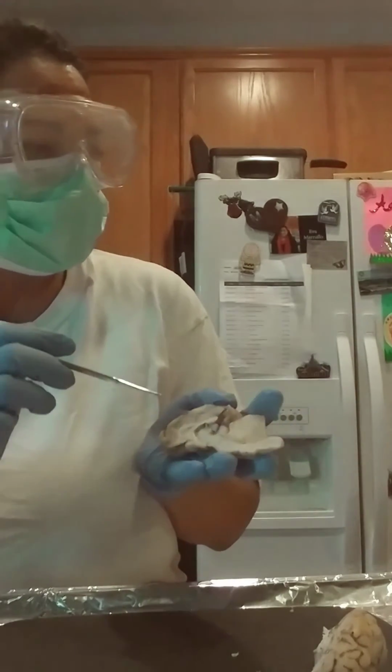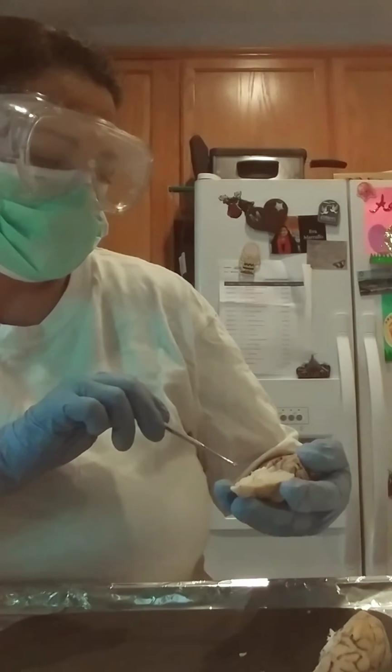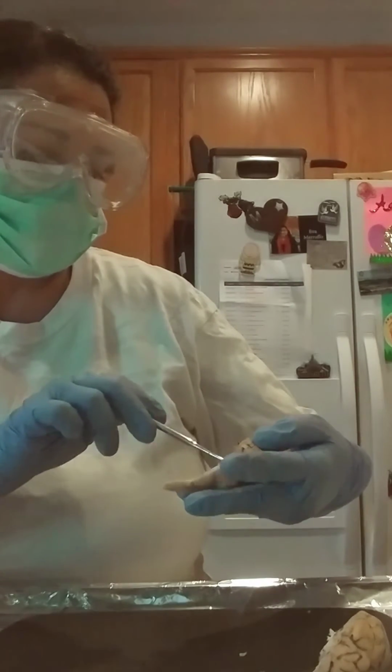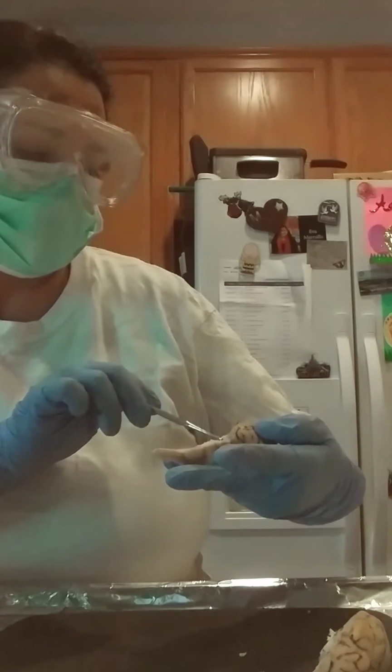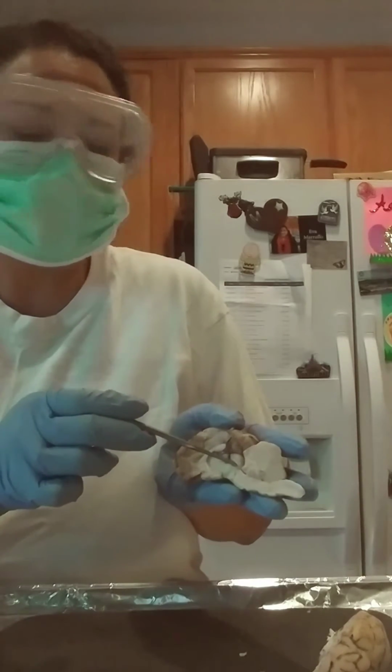And then the pineal gland is, let me see, the pineal gland was right back here. So I believe the pineal gland is right here in that area.